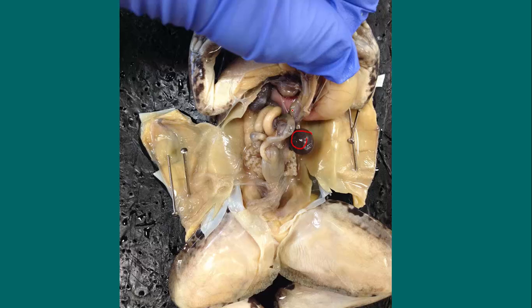What we're interested in here are the small intestines that are winding around, and what you'll notice is that this leads into this larger, much wider structure right here, which is the large intestine. So this area right here is the large intestine, and that leads to the rectum and the cloaca. The cloaca is a single opening where amphibians eliminate all of their waste and their reproductive cells.